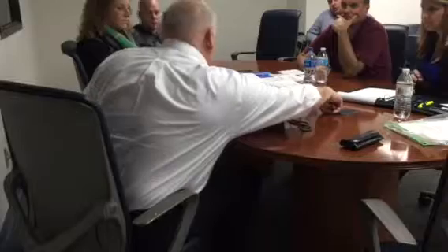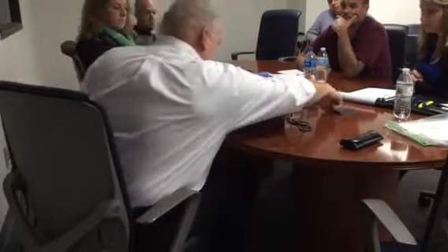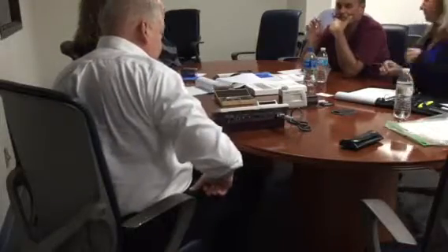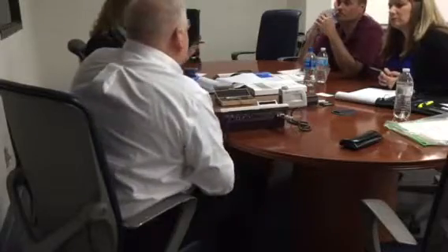Which works out to be about 0.08 something. So 2.97 plus 0.08 and minus 0.08 is your range. We're gonna calibrate anyways, because... What if you were getting big differences in those? Yeah, I was gonna say, four numbers? What's the troubleshooting? That would happen because your stylus is probably worn and frayed.